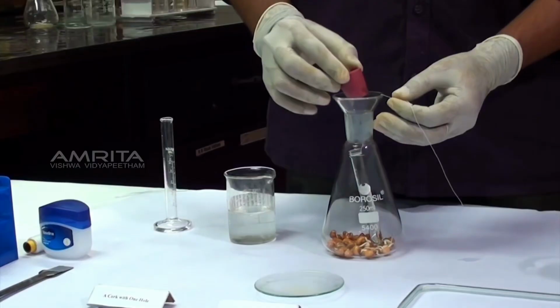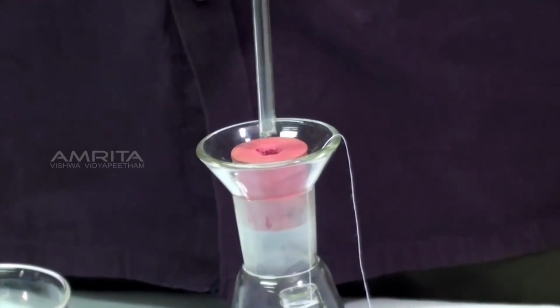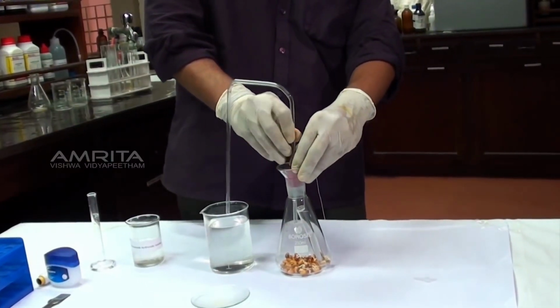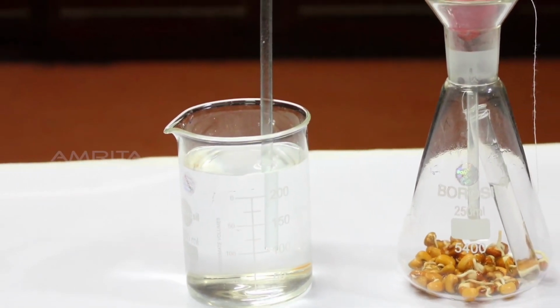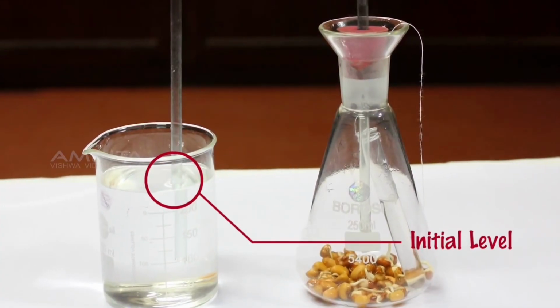Close the mouth of the conical flask with a cork. Insert one end of the delivery tube into the conical flask through the cork and dip the other in a beaker containing water. Observe the position of the water level in the delivery tube. This is the initial reading of the water level in the delivery tube.